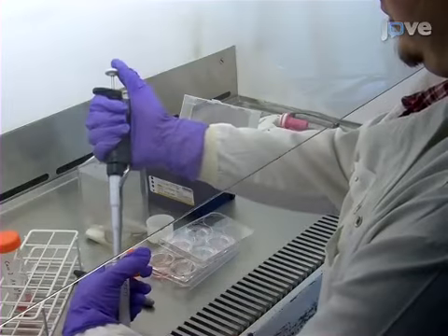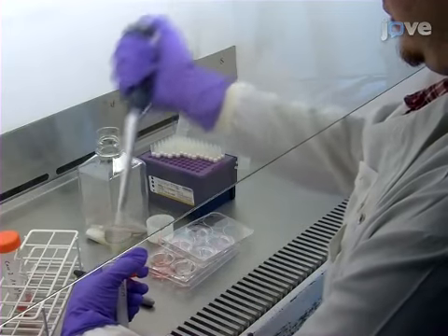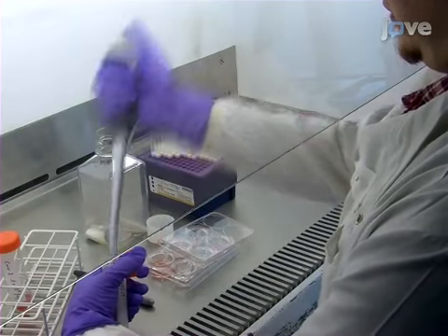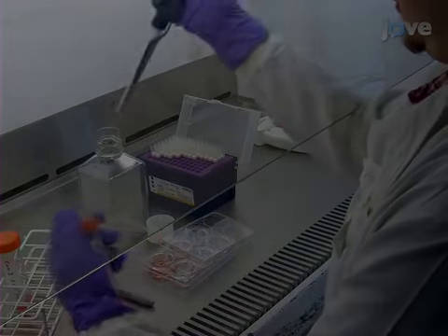Begin by seeding 4 × 10⁵ Caco-2 intestinal epithelial cells per 0.4 micron filter in culture medium.